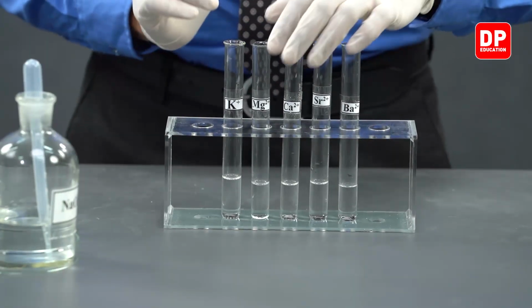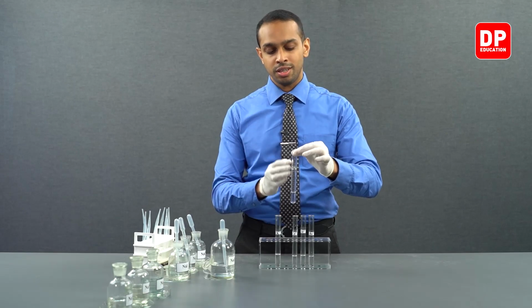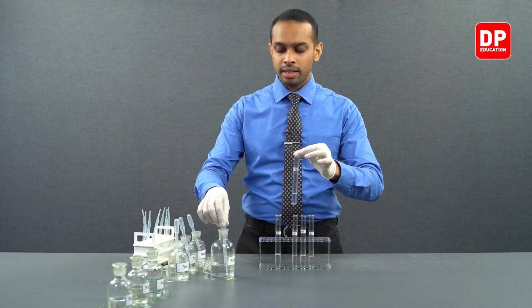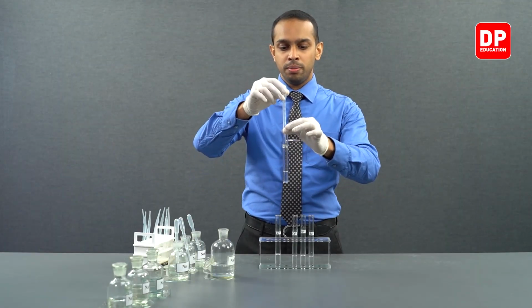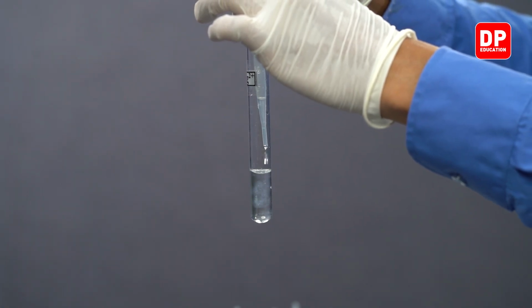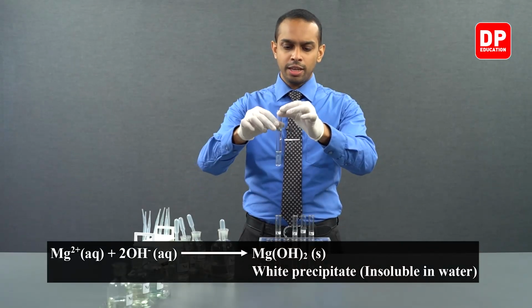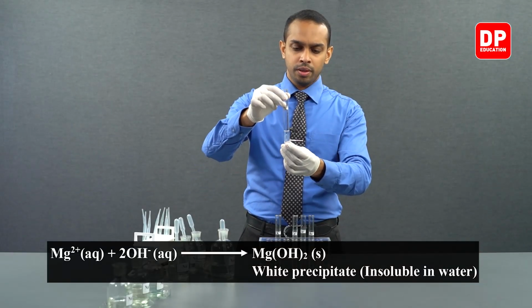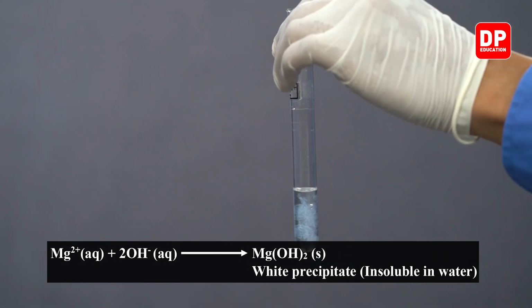Let's move on to magnesium 2 plus aqueous ion solutions. This is a group 2 cation. Let's add a little bit of sodium hydroxide. As you can see, upon addition of sodium hydroxide, let's add a little bit more.